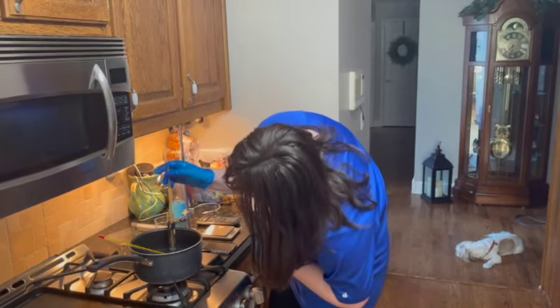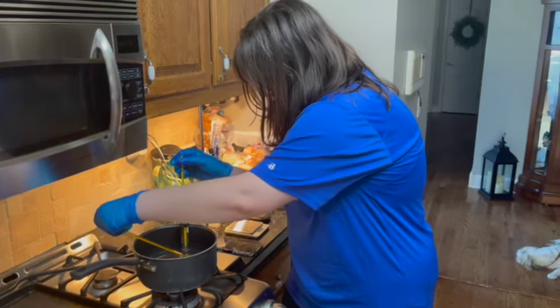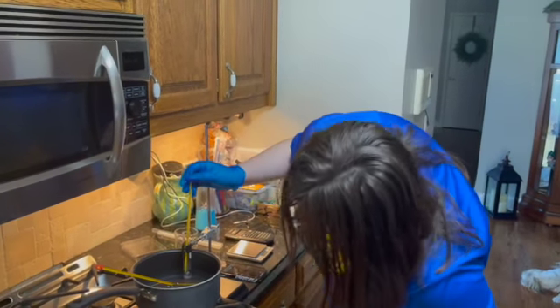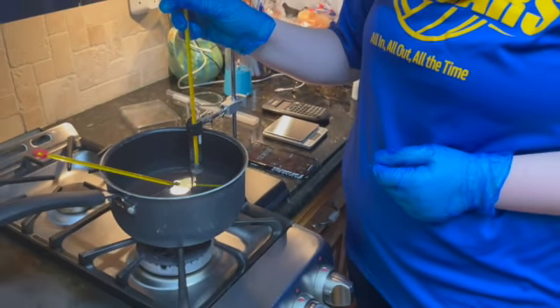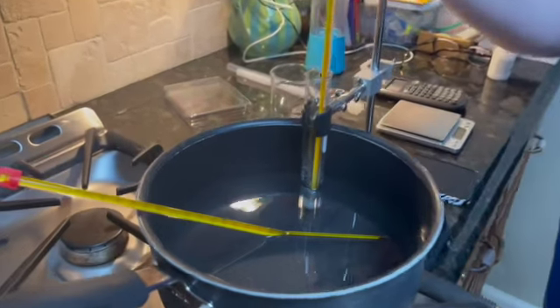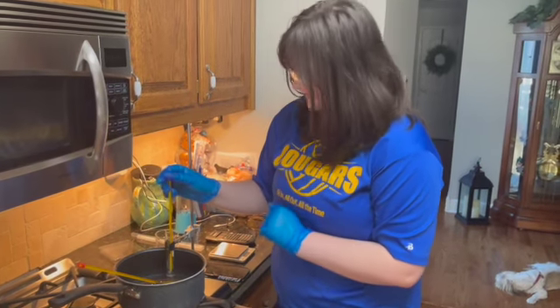So now we're at the 13-minute mark, and it has actually gone down to 53. Now it's a lot closer to 53, and our hot bath is at 54, and it's gone down as well to be closer to 54 than 55. And looking at it, it is almost completely melted. We still got some time because it has to completely melt through, but I'm trying to make sure to keep the thermometer away from the edges, because that can be a sign of human error, which I'll talk about later, in the temperature of the solvent during this entire process.